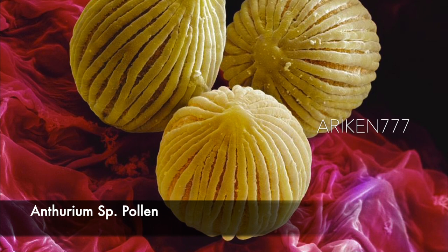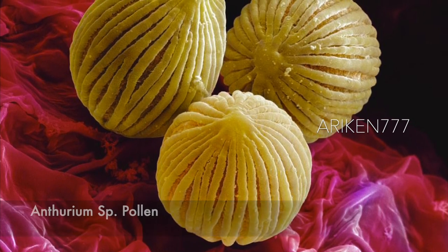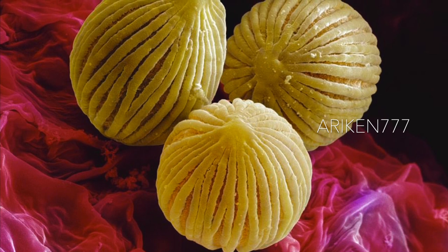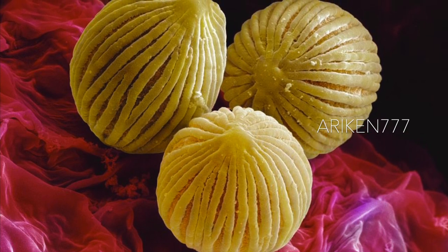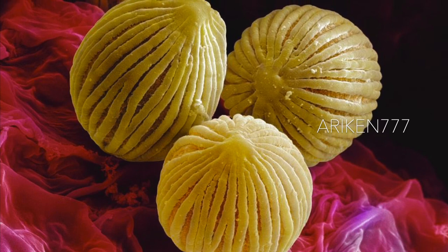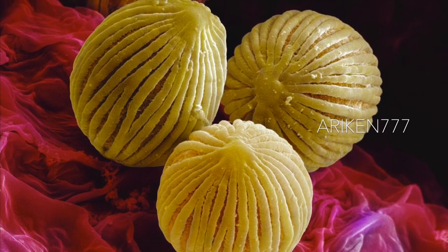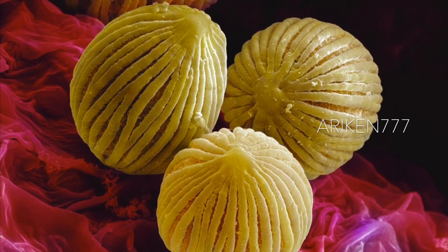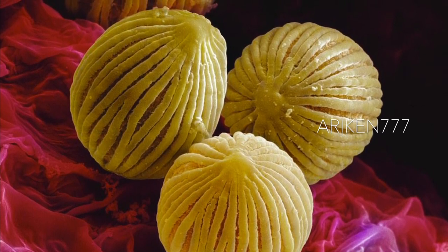These are the pollen grains of an anthurium flower, which have dropped from the spadix onto the brightly colored spathe of the plant. The spadix is typically a type of spike inflorescence which is surrounded by a leaf-like bract known as a spathe. So the flower of the anthurium is a spadix with a large colorful spathe around it.